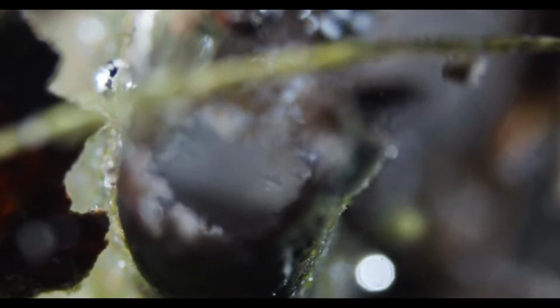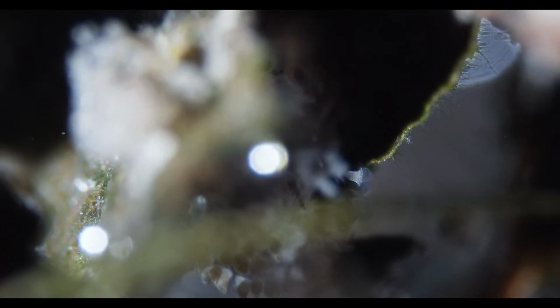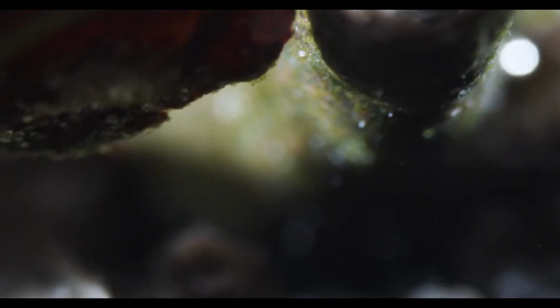Some Vorticella. Is that the same? Yeah, that's the same Carchesium colony. These are quite big. This colony has a diameter of 1 millimeter. But you can definitely see it with the naked eye. The colony, that is. Or you can see that it's made up of little spots.